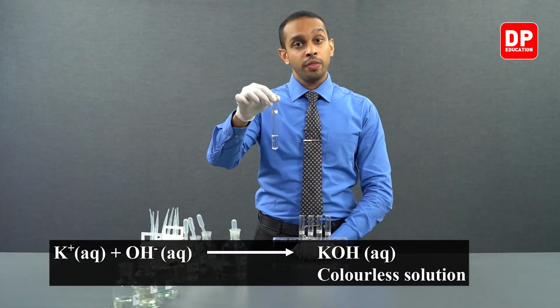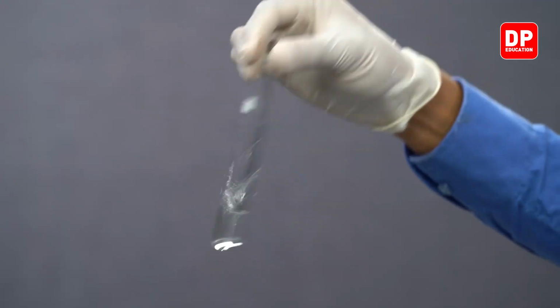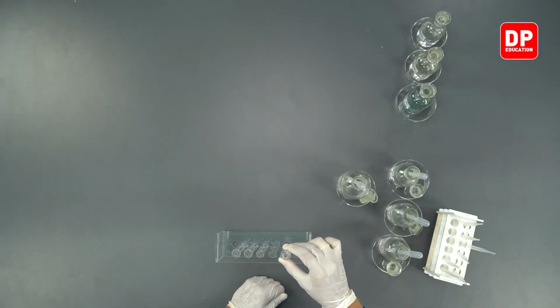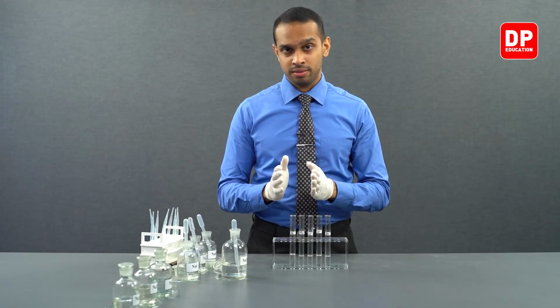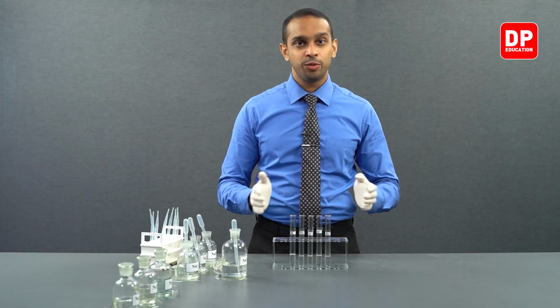You can see they do not form a precipitate. This indicates potassium hydroxide does not produce a precipitate. Similarly, all of the group 1 element hydroxides are soluble in water.